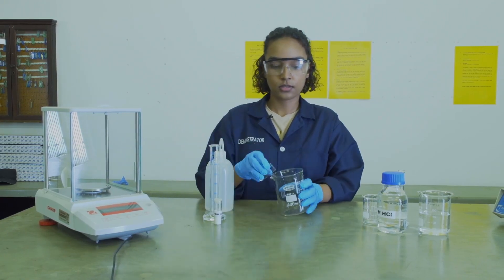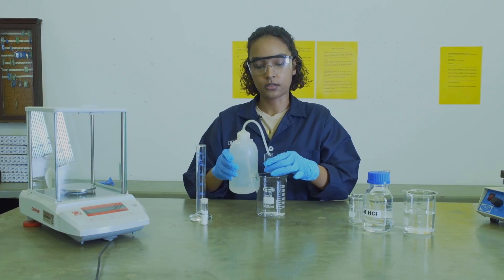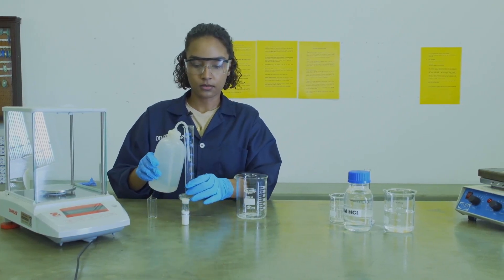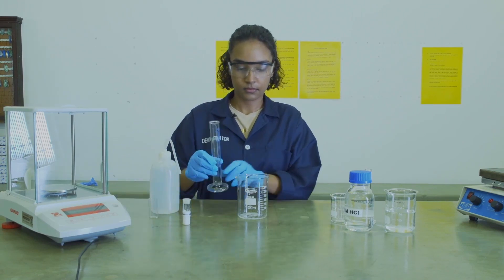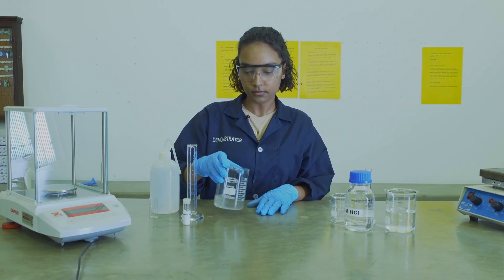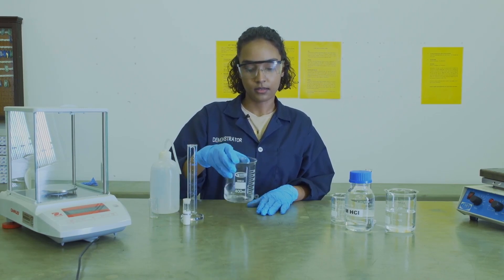After you have weighed out the salt, you can transfer this to a 400 ml beaker, and you can add some water to the weighing vial in order to transfer all the contents. This is followed by adding 20 ml of distilled water. You can swirl this to mix the contents in the beaker. Ensure that the contents in the beaker are all dissolved before moving on and adding anything else to it.